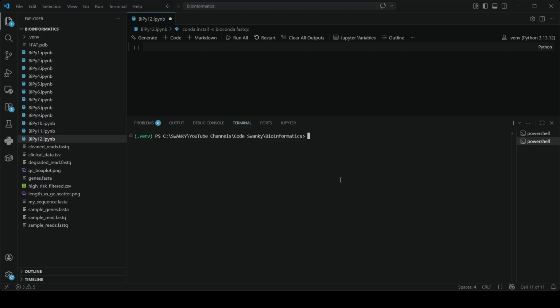When you are working with a real data set containing like 15 million reads, you don't write a custom Python loop to check the quality normally. You use the industry standard. So today we are heading back into the Linux terminal to learn FastQC. It is a tool written in Java that instantly generates a beautiful comprehensive HTML report of your sequencing quality. If you do NGS analysis, you will use FastQC basically every single day of your career. So yeah, let's get started.